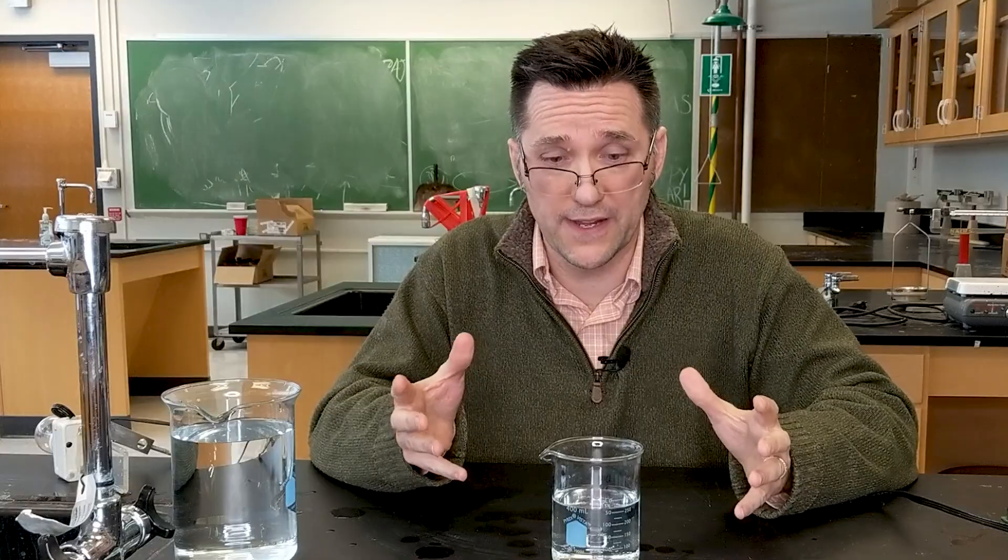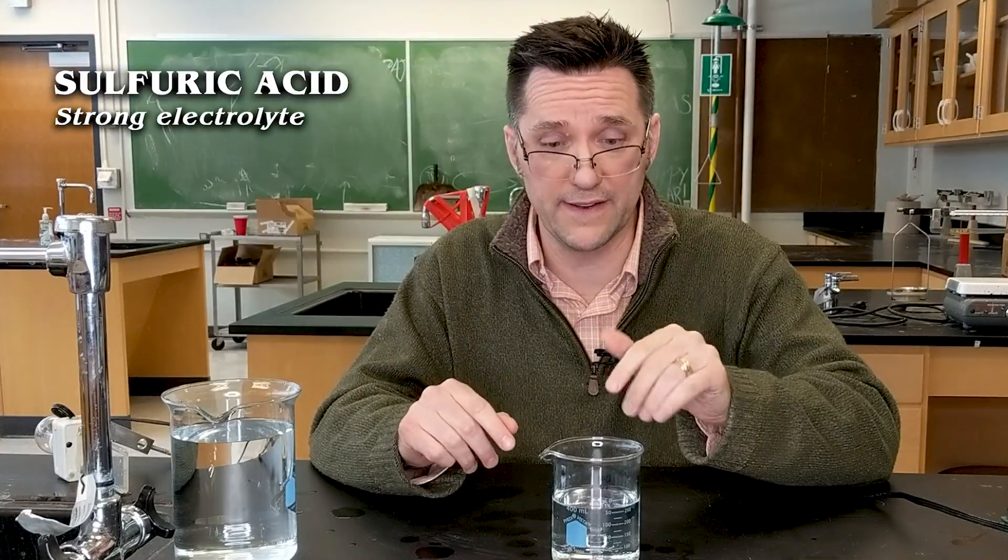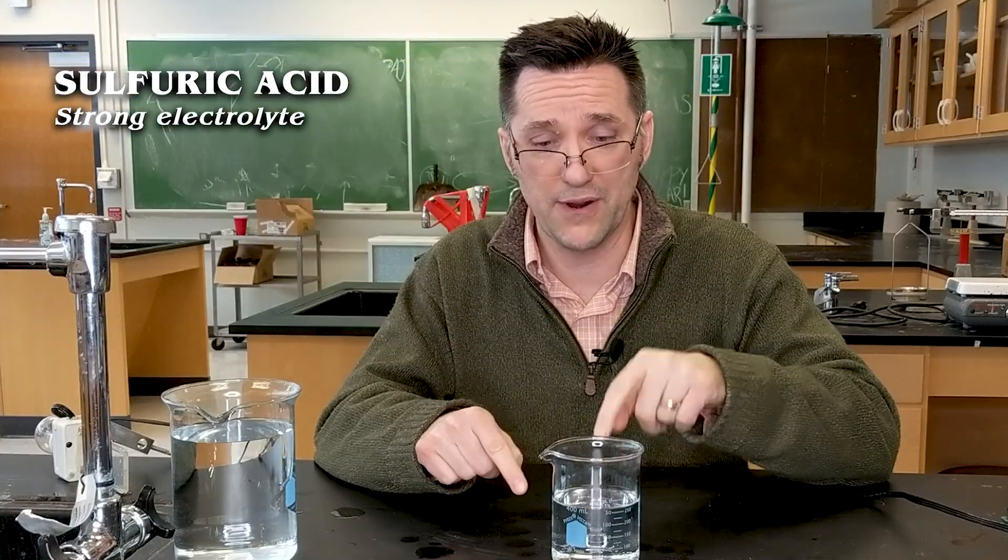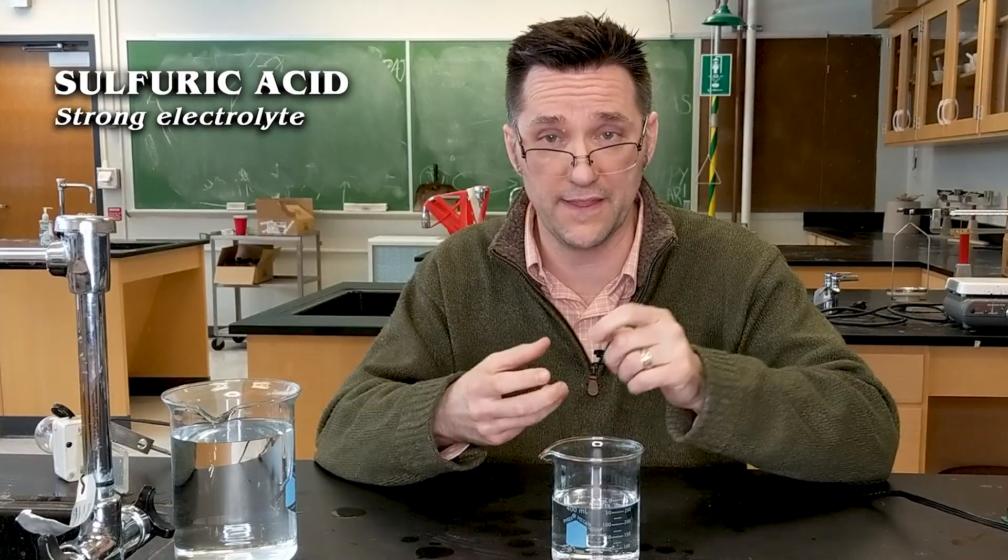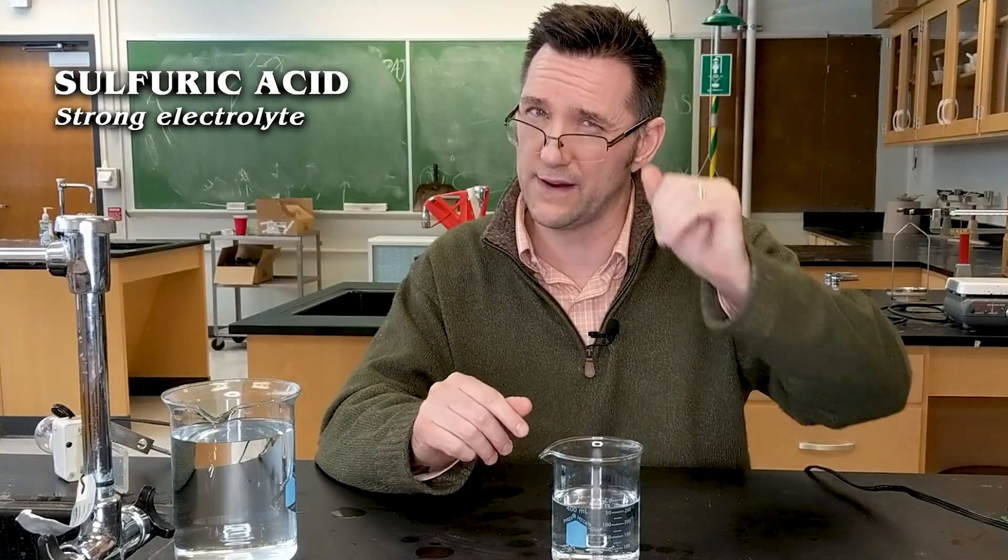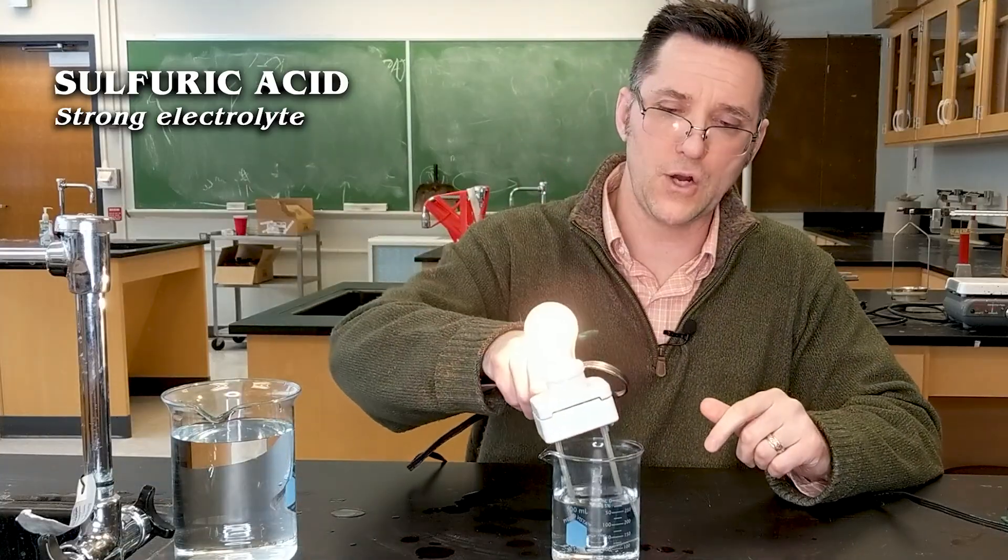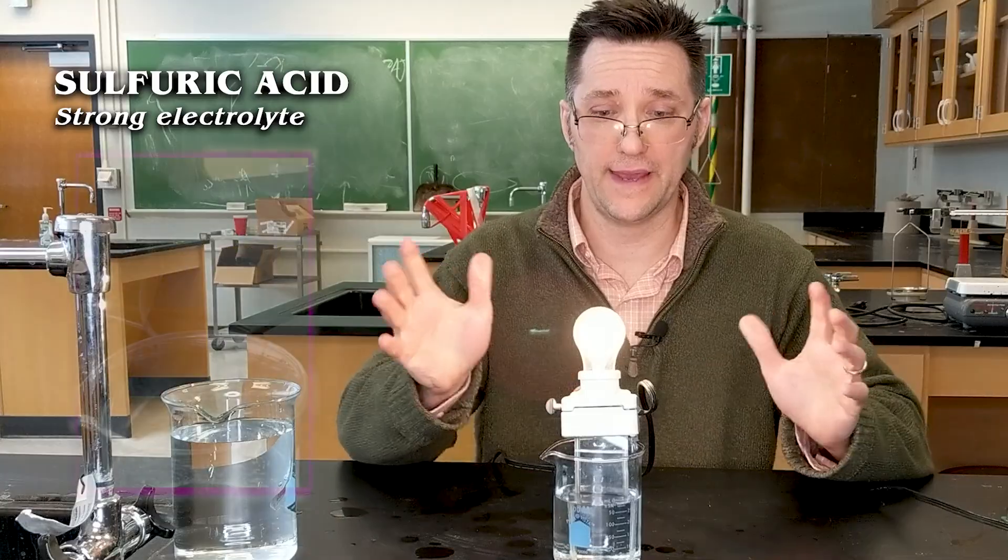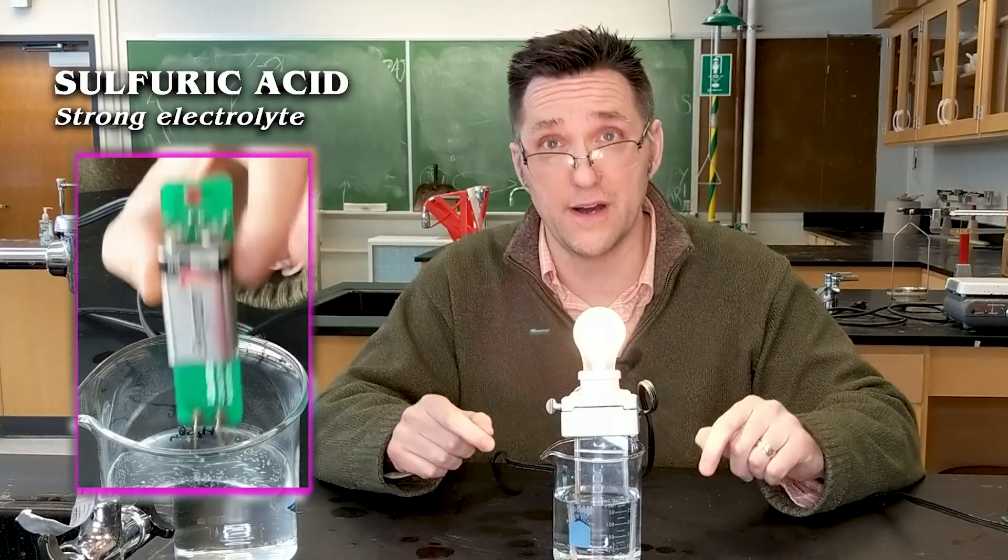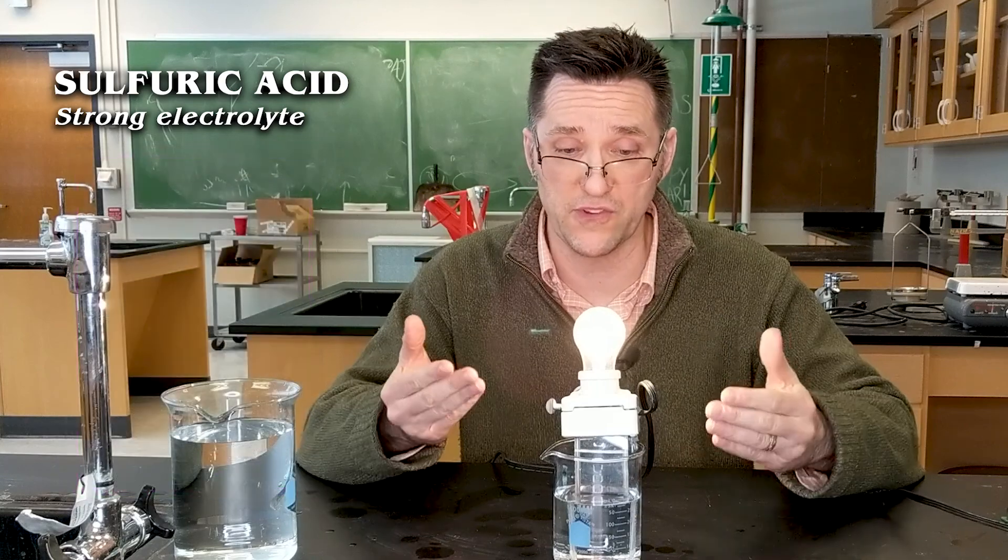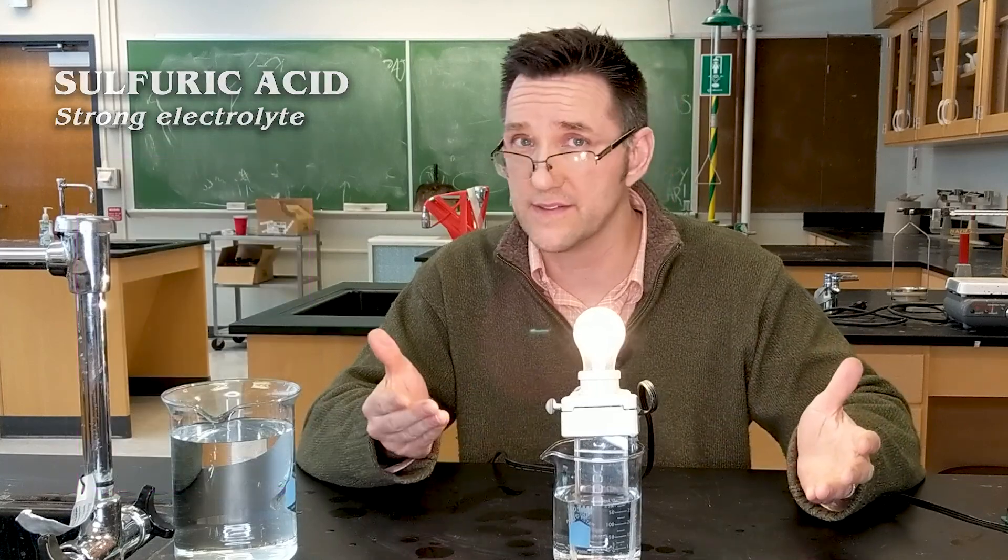We're going to finish up with sulfuric acid. This is considered a strong acid, even though this is dilute. Remember, I don't care how much sulfuric acid you put in there. It's always a strong acid because it always completely dissociates. One drop in a bucket, strong acid. One drop in a thimble, it's still a strong acid, just a lot higher in concentration. So here we go. Watch this. And I can see we got some bubbles coming off here. So we got some electrolysis going on. We're splitting up the water into hydrogen gas and oxygen gas.